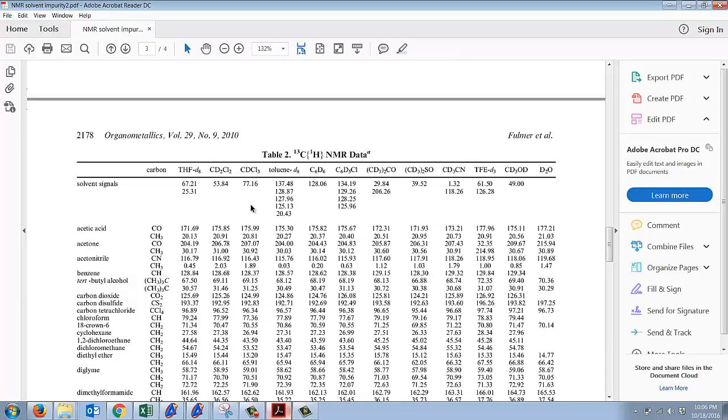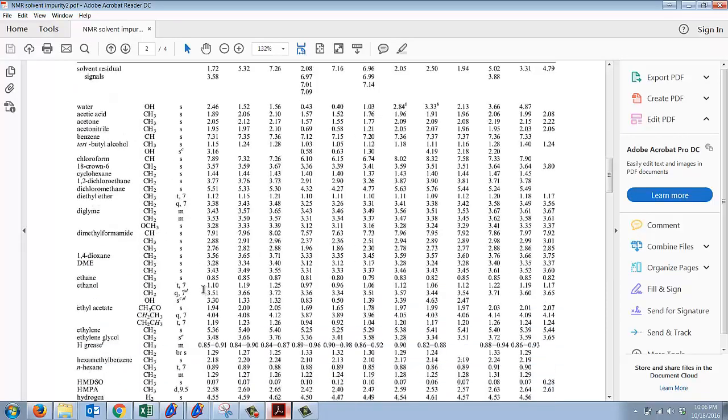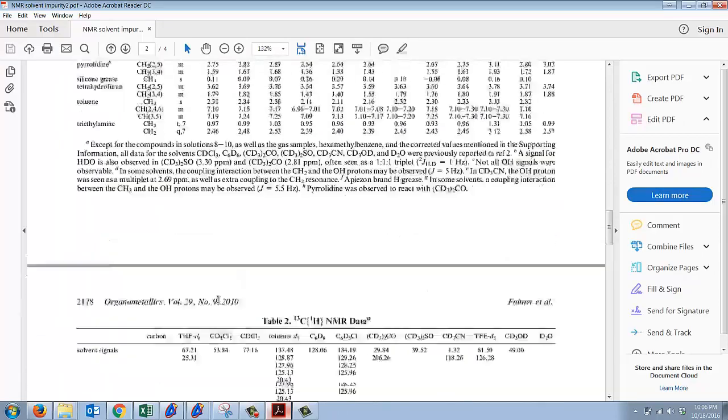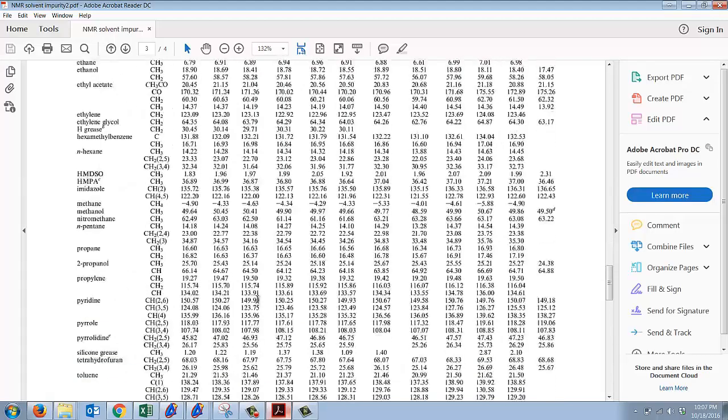If you have it on the proton NMR, it better be on the carbon NMR. Otherwise, it might be something different. Just because you see even one or two of those peaks, you need to have all the peaks for them to be present. For instance, again with ethyl acetate, if you see a peak at 21, 171, 60, and 14, it's probably ethyl acetate. However, if you only see 170 and you see 14, it can't be ethyl acetate. All of those peaks have to be there.